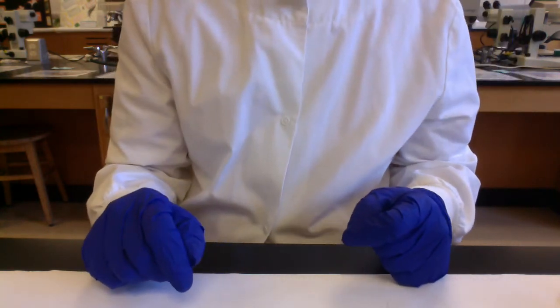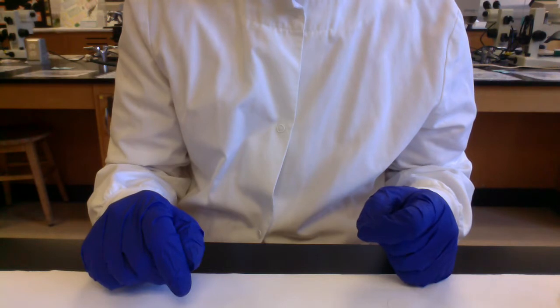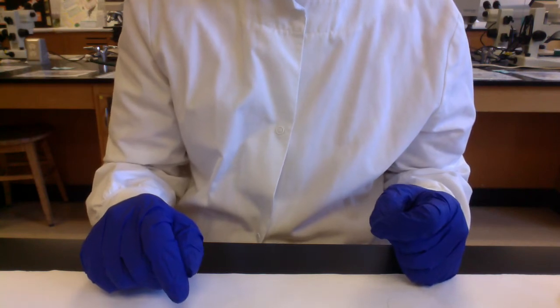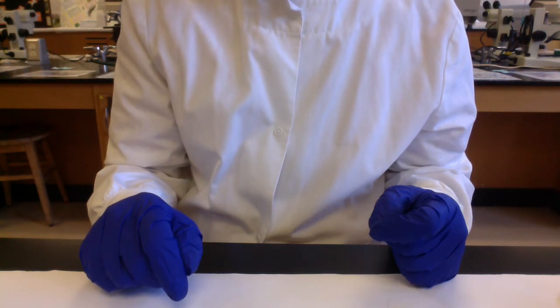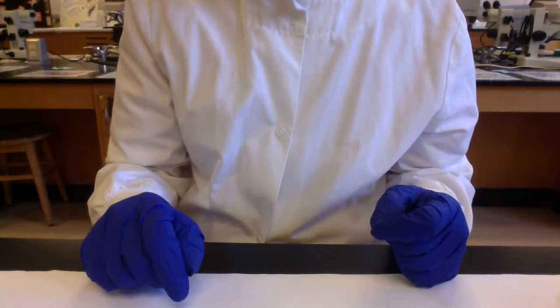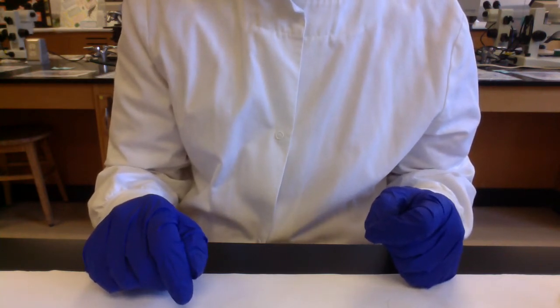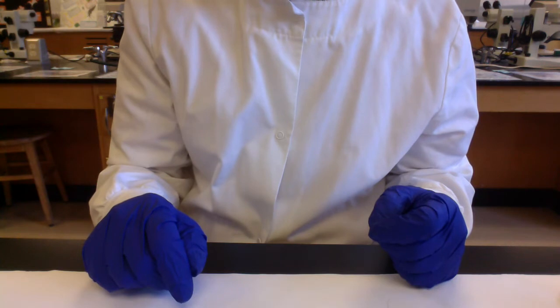Because what we're going to be doing is seeing how many microbes land on the surface of our agar plates, how many microbes can grow and form visible colonies. So we'll count the total number of colonies to reflect the number of microbes in the air that landed on the surface of the plate. And then we'll be looking at different types of colony morphologies, the different sizes, colors, shapes, the different patterns of borders, the different textures of the surface of the colonies. The reason for this is that we presume that different microbes will form different types of colonies. So by counting the total number of different colony varieties, we get an idea of the variety of microbes that are going on our plates.